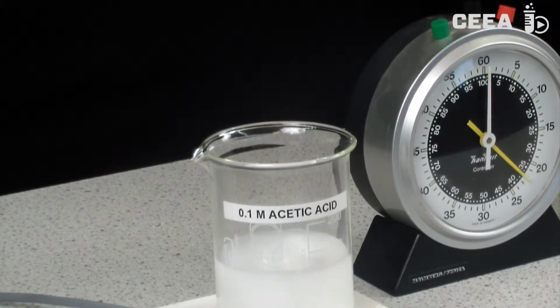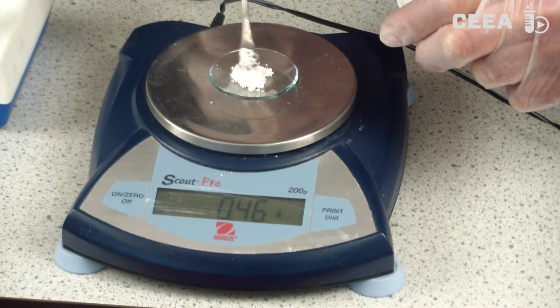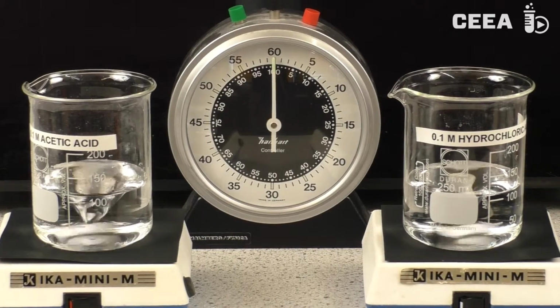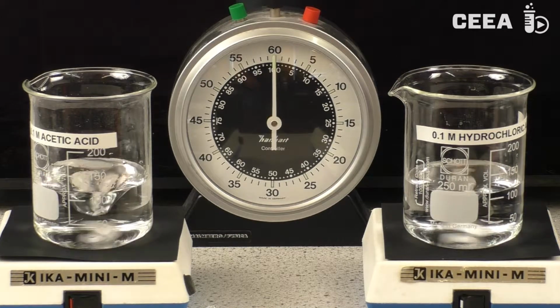The experiments are scheduled to be conducted with 100 ml of 0.1 M monoprotic acid solutions. Then the stoichiometric quantity of calcium carbonate amounts to 0.5 grams. The experimental setup consists of two beakers, the left one containing acetic acid solution and the right one filled with a hydrochloric acid solution. After addition of the calcium carbonate, the reaction time is measured.